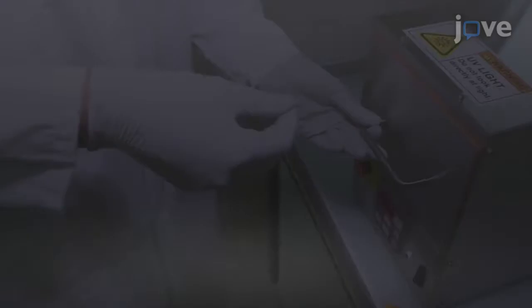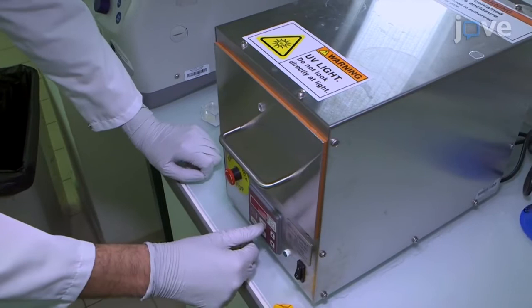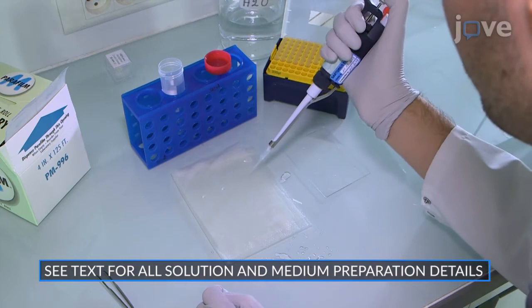To prepare coverslips for micropatterning, activate ethanol-sterilized 25 mm diameter glass coverslips under deep ultraviolet light for 5 minutes. While the coverslips are being activated, add one 30 µL drop of poly-L-lysine graft polyethylene glycol per coverslip onto a piece of paraffin film within a humid chamber.